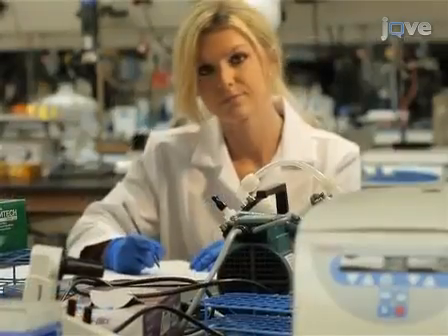Demonstrating the technique today will be two technicians from our laboratory, Rohit Sukumar and Natalie Cummings.